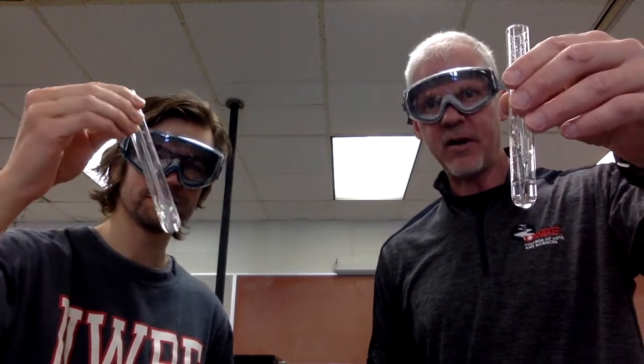We're back. We're looking at the second part of the experiment now. This will be table B on your report sheet. And what this looks at is miscibility of liquids. So we've got test tubes here with a little bit of water in them.